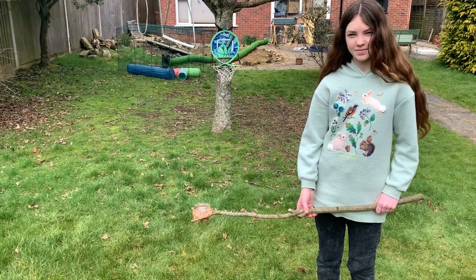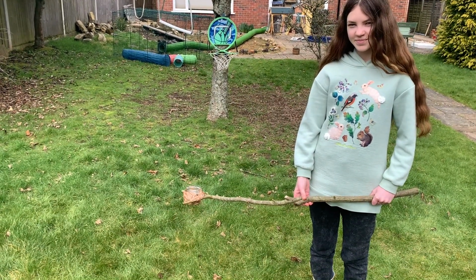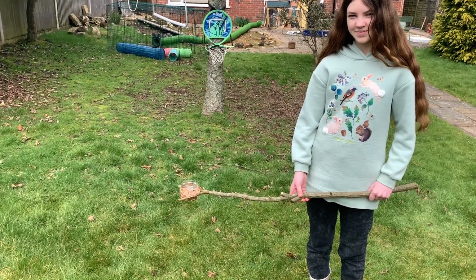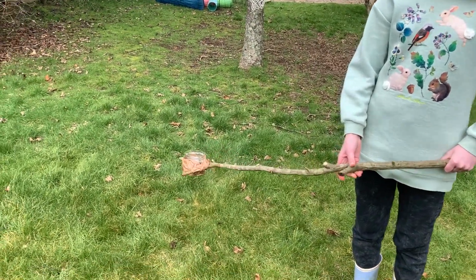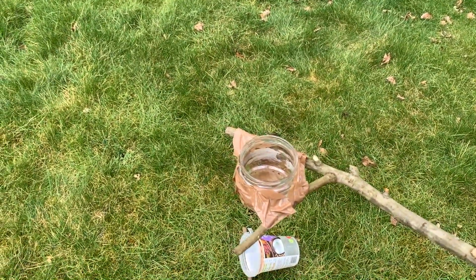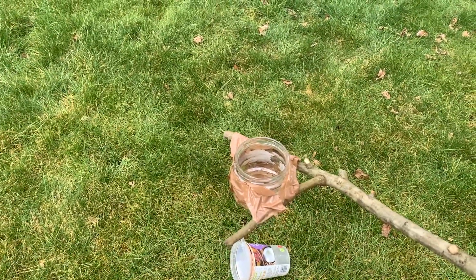You'll have received your tiny test kit and some instructions. So before you leave your house, you'll need to create a reacher stick. We have Rebecca here modeling one that we made. You want to show them? So it's just a stick with a container that we've cleaned really well, and it's taped to the stick there.